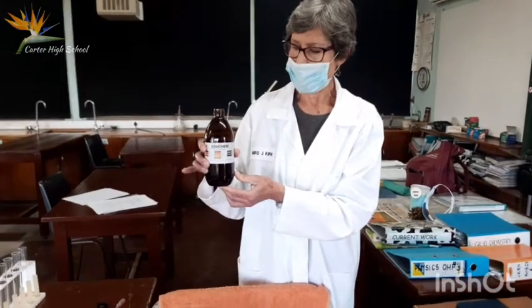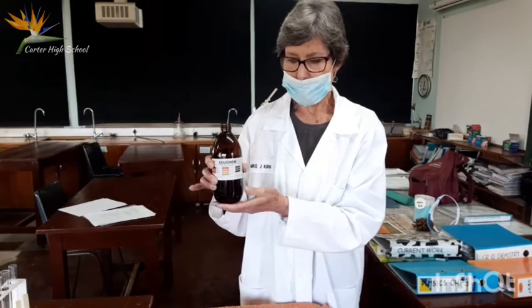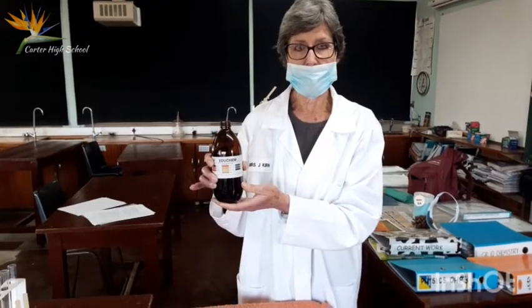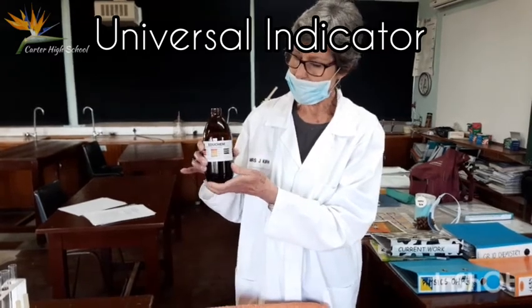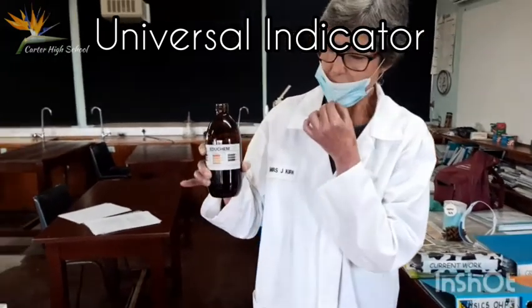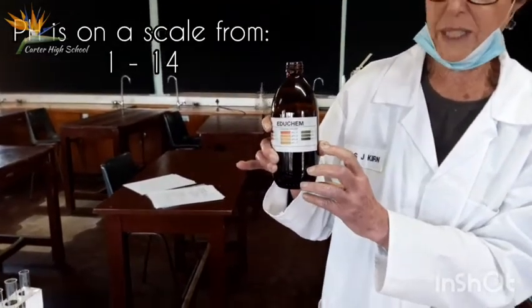This is universal indicator. It's actually a mixture of several indicators which not only tell you whether a substance is alkaline or acid, but actually gives you a reading on the side. Now, you people haven't done pHs yet, but pHs are on a scale from 1 to 14.